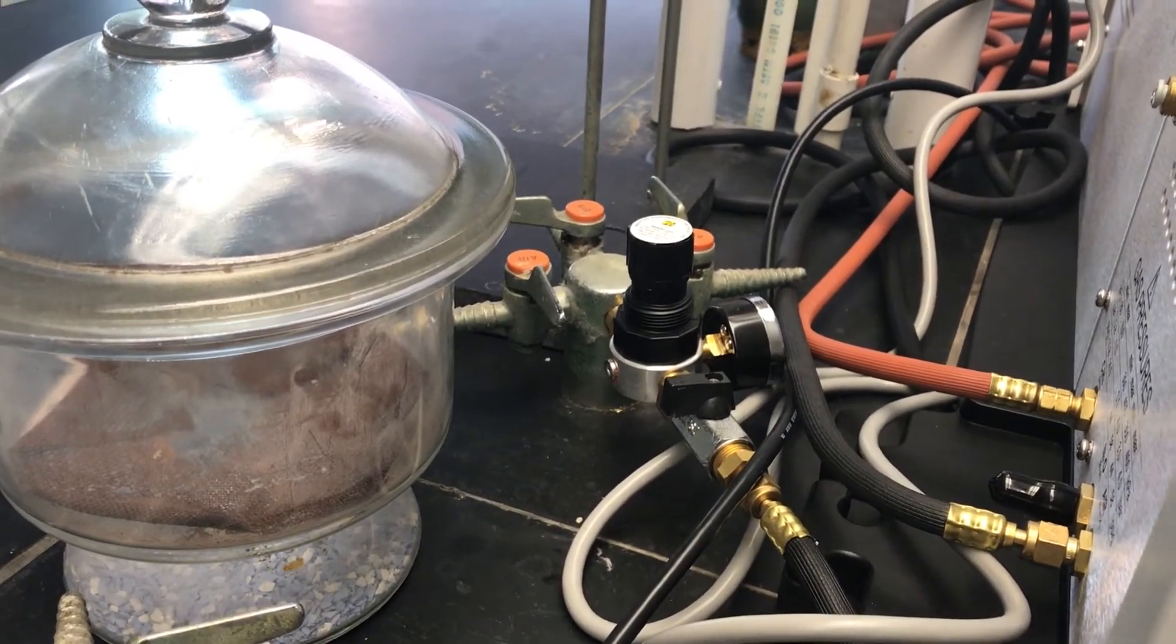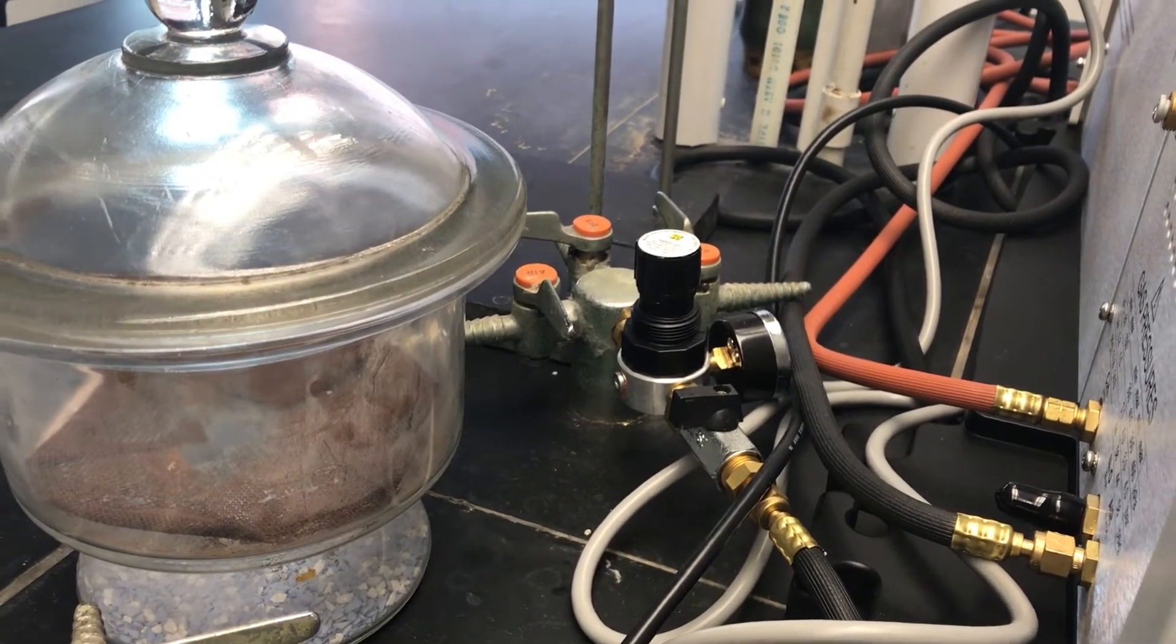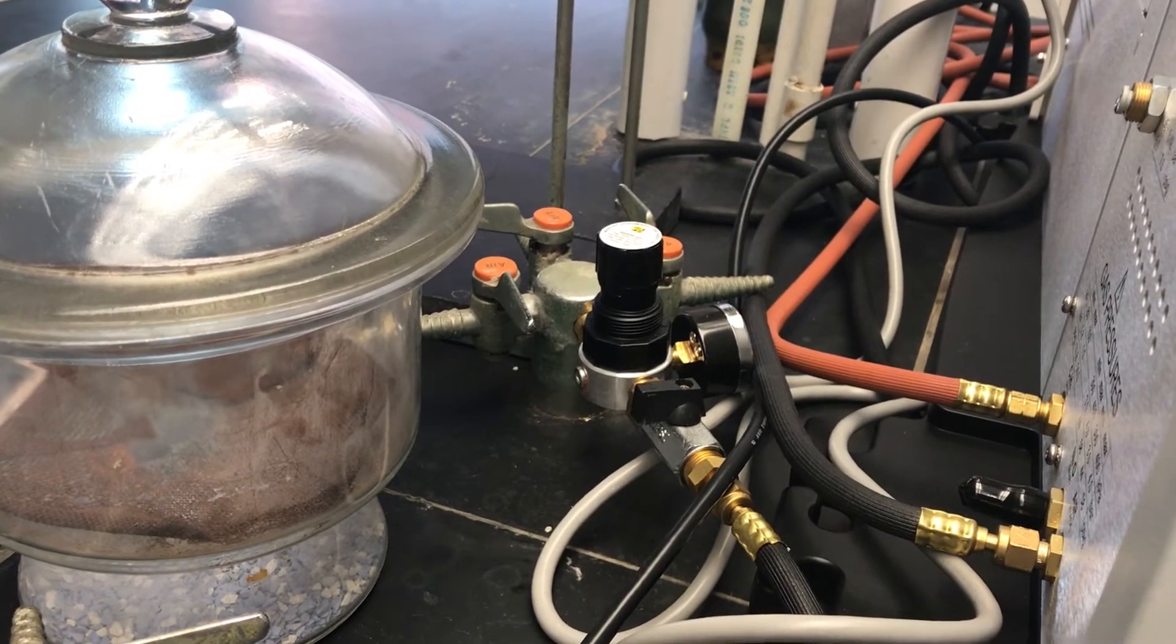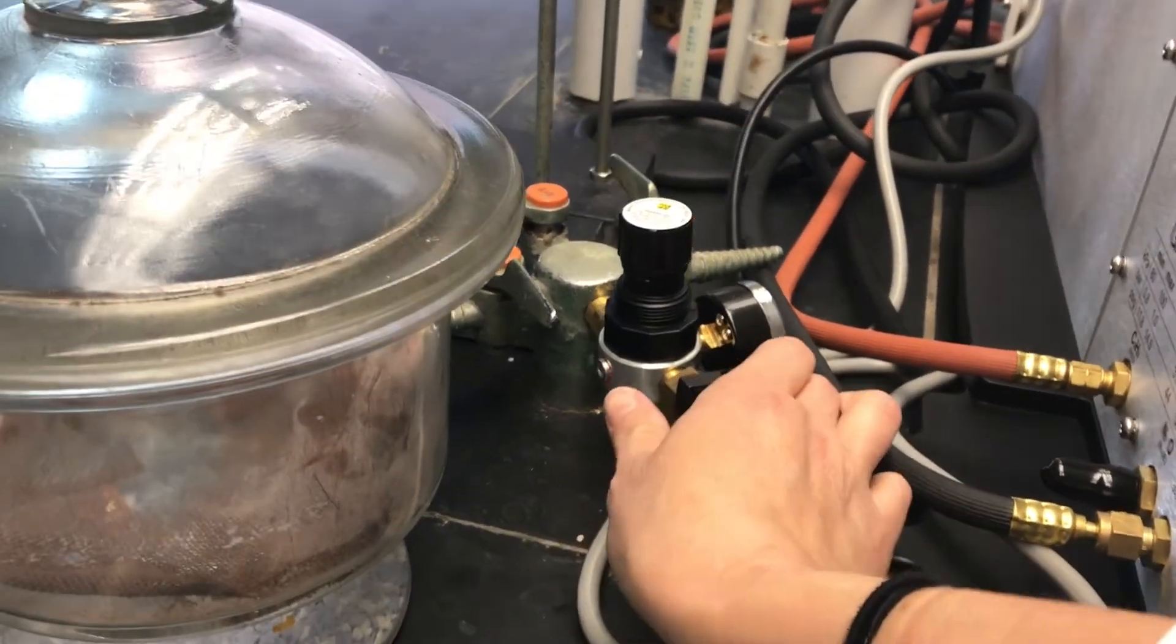We're using house air for the air in the spectrometer, and so you turn on the air behind the spectrometer by opening this valve.